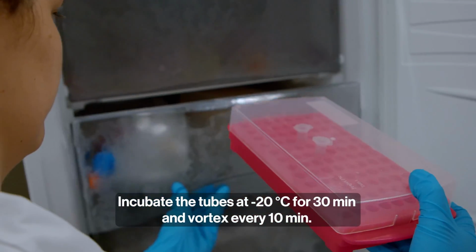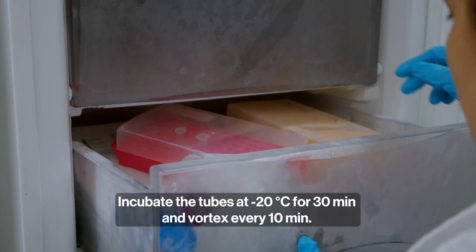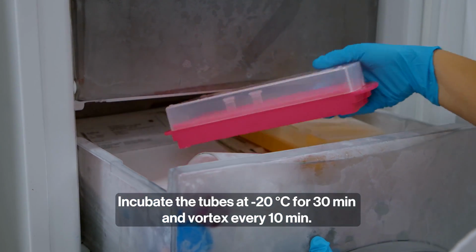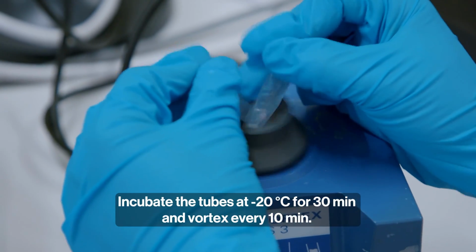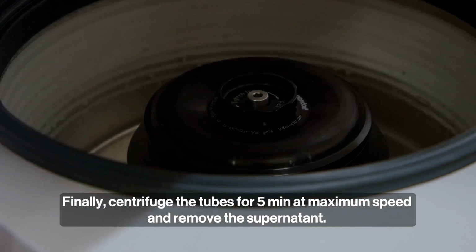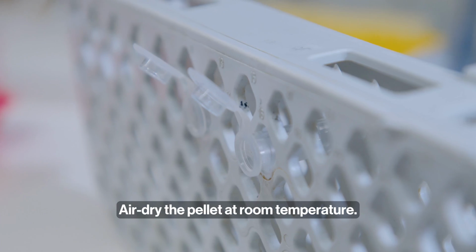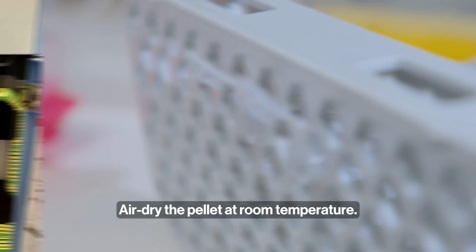Incubate the tubes at -20 degrees for 30 minutes and vortex every 10 minutes. Finally, centrifuge the tubes for 5 minutes at maximum speed and remove the supernatant. Air dry the pellet at room temperature.